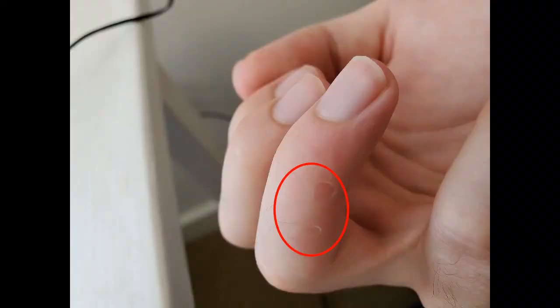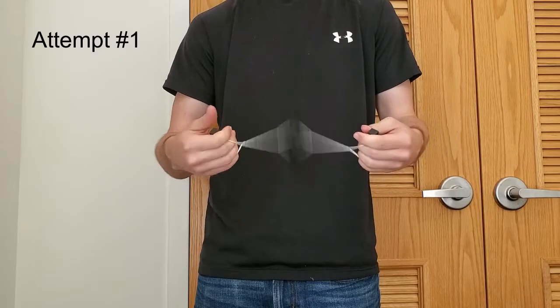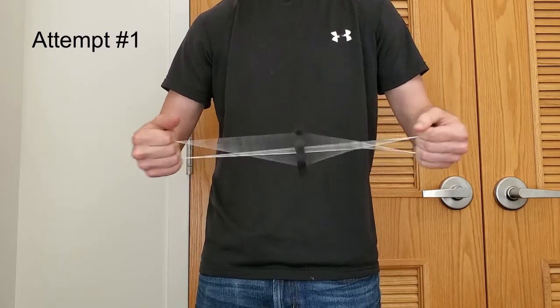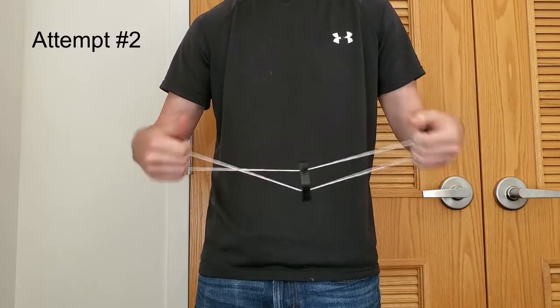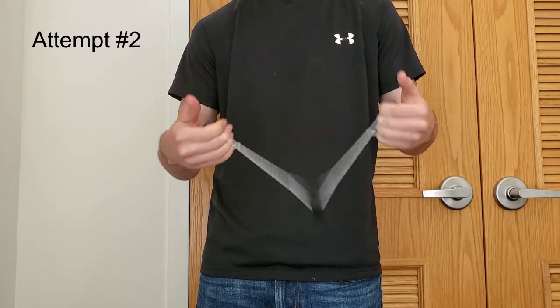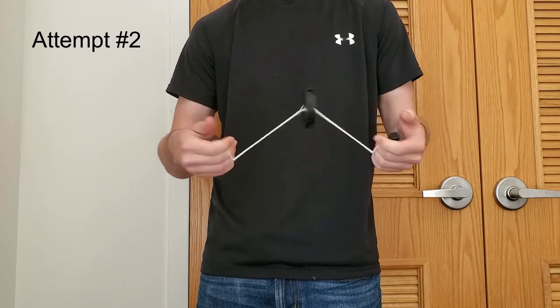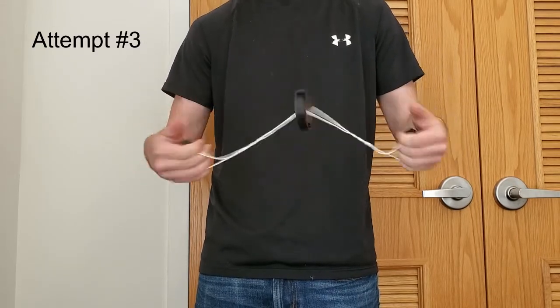The next thing is that ropes used in the device can actually cause you a bit of rope burn and blisters if you're not careful. The last thing is that actually getting the device started is much more challenging than you might think initially. It does get easier with practice, but it can definitely be frustrating at times.